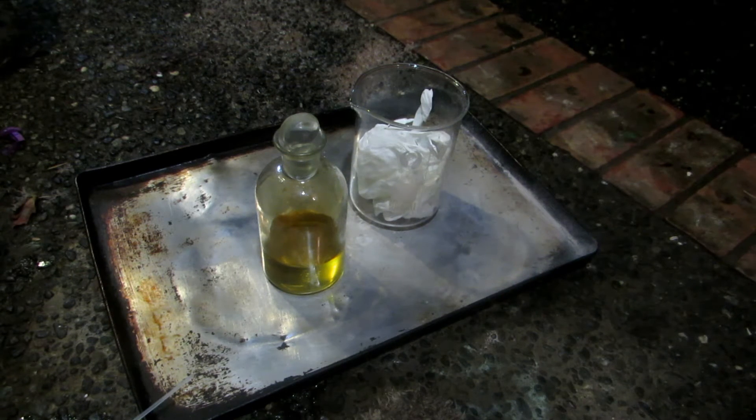And I'll show you exactly why. Any gloves such as latex or vinyl, or nitrile of course, will all have very similar reactions. You never want to wear gloves unless they are specifically designed to withstand highly concentrated nitric acid.